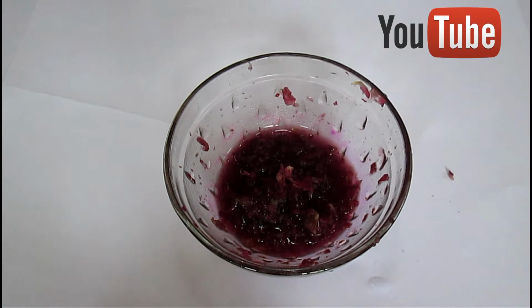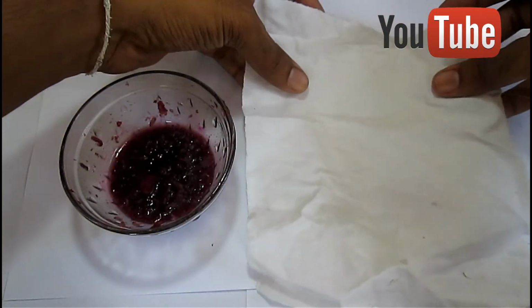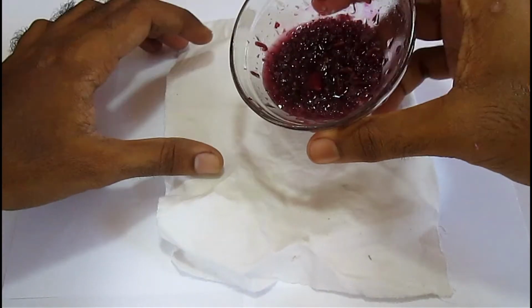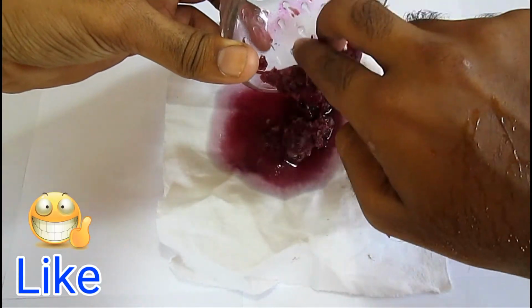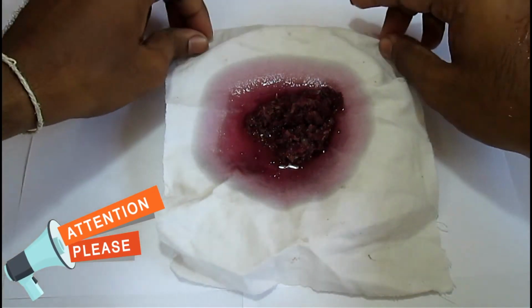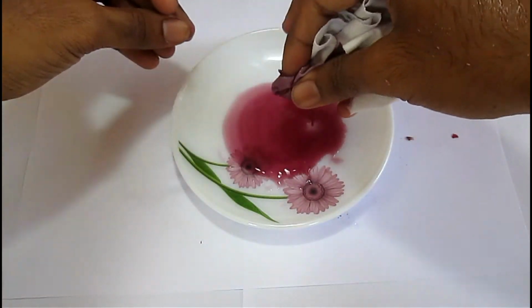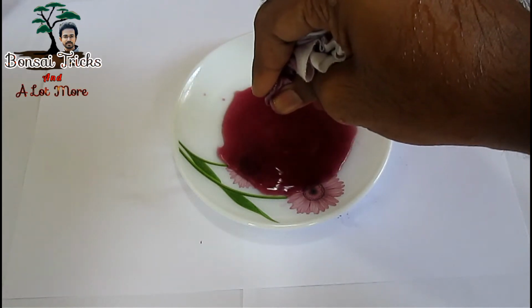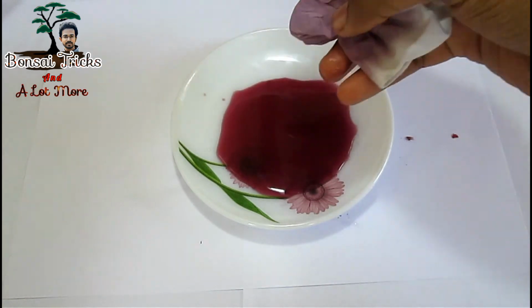Now our pH indicator is ready. If you like, you can use the rose petal juice directly, but I prefer to filter the extract. I am using a piece of white cloth to extract the juice. But friends, one thing to be remembered, wash the piece of cloth with warm water before applying. Do not use detergent to wash your cloth, otherwise the high pH level of the detergent will ruin your pH tester solution or rose juice.